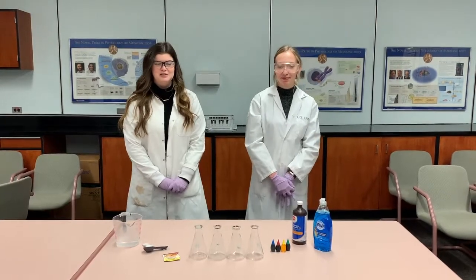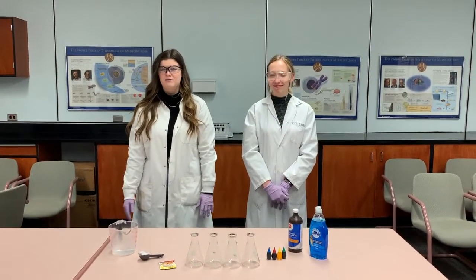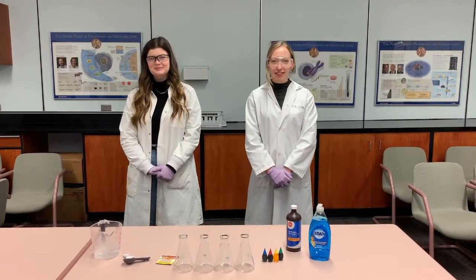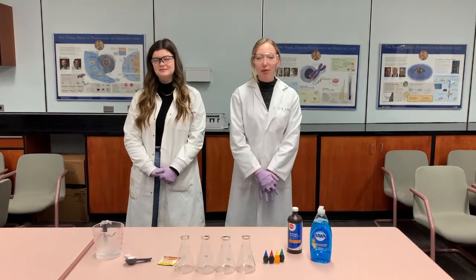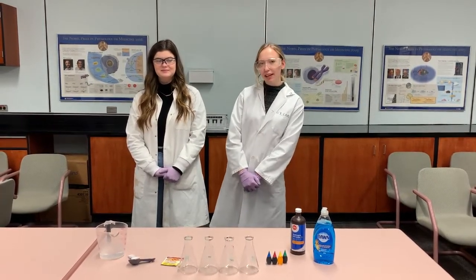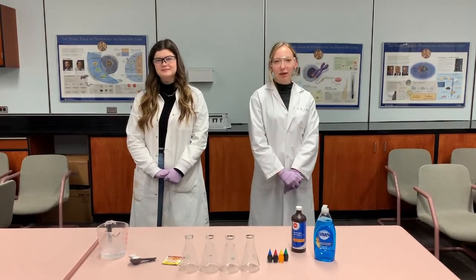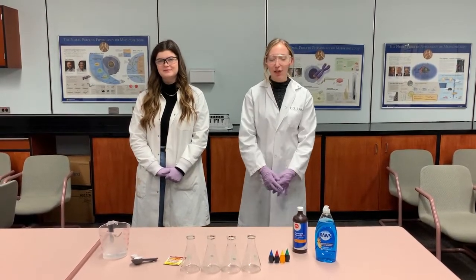Enzymes are proteins which speed up chemical reactions. All of you have over a thousand enzymes in your body helping you survive. When two chemicals need to react, enzymes help them do so. These chemicals are known as the substrates. Today we will be using an enzyme in yeast known as catalase, which produces oxygen as a product. This oxygen can be visualized as foam.